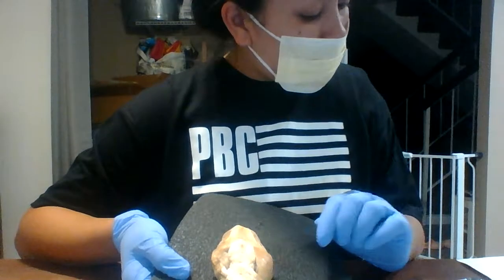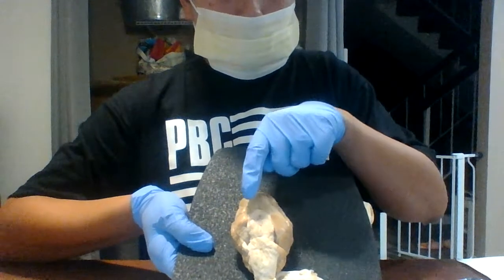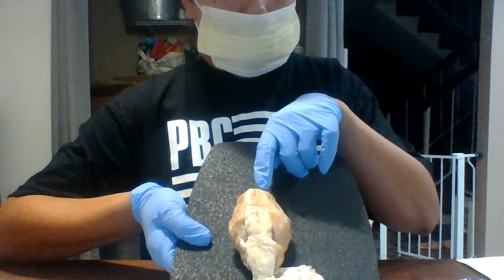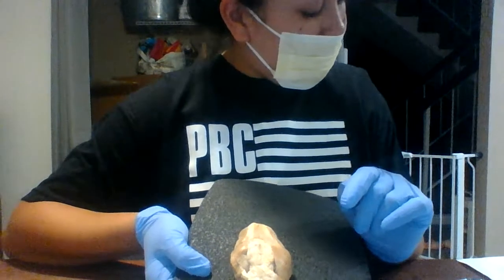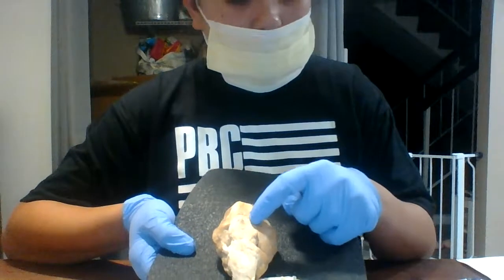The olfactory bulb is going to be, there's two like channels, they look like tubes up here. The olfactory one is going to be this one over here. The optic chiasma, if I'm saying it correctly, it's going to be the top point.